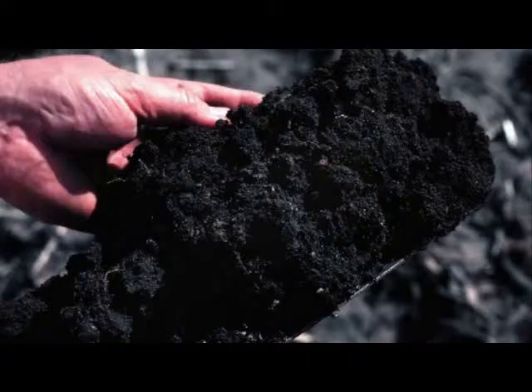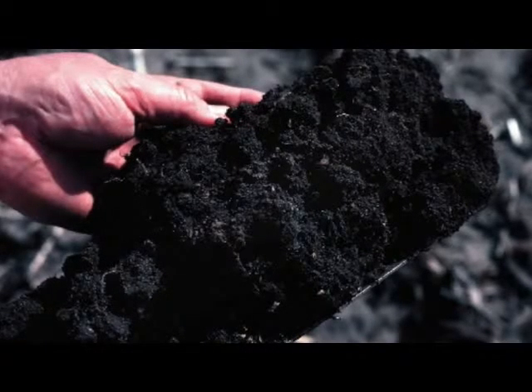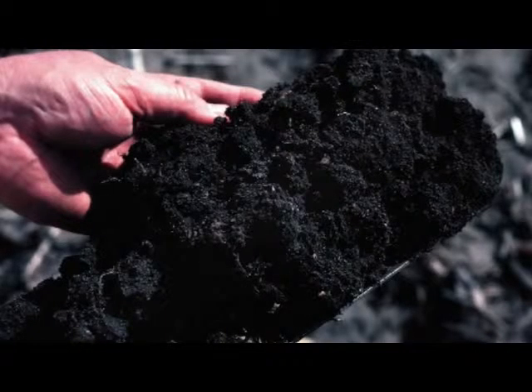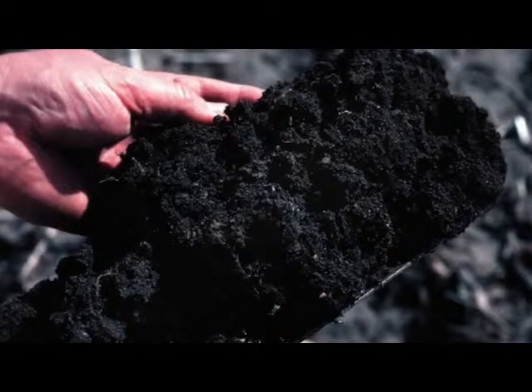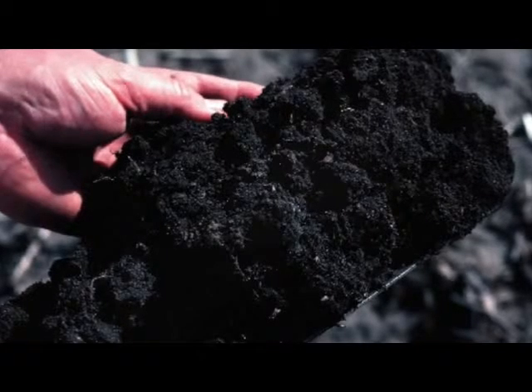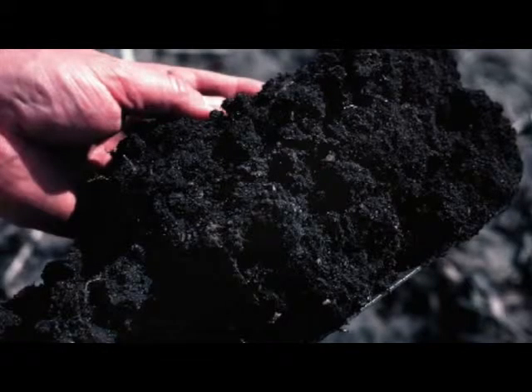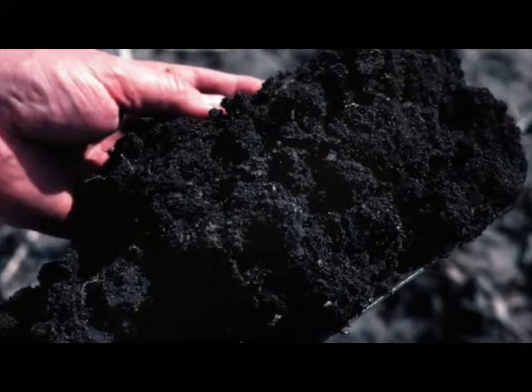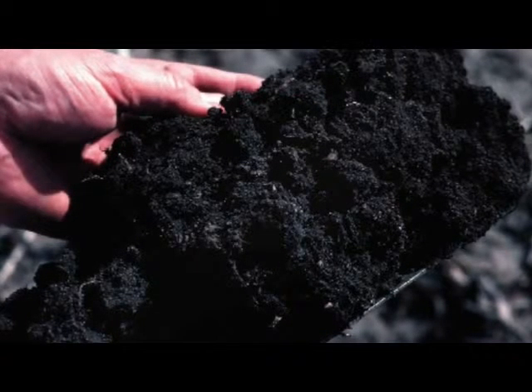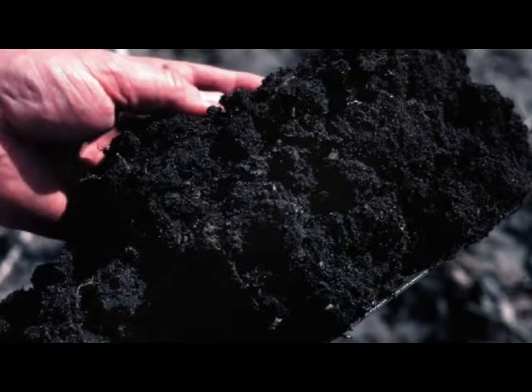The final outcomes of this sampling procedure will be soil samples that can be used for quantifying not only the amount of organic matter in the soil, but also the bulk density, particle size, other nutrients such as nitrogen and phosphorus, the concentration of stable and radioisotopes, as well as geophysical properties for identifying sediment provenance. The list of analyses you will perform will dictate the steps for sample preparation. This will be covered in subsequent videos.